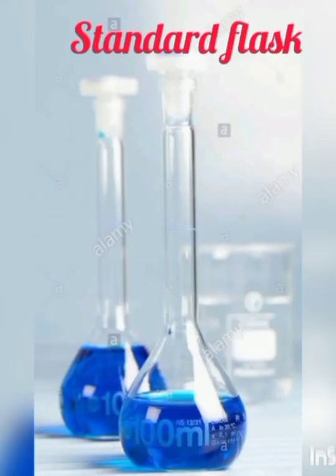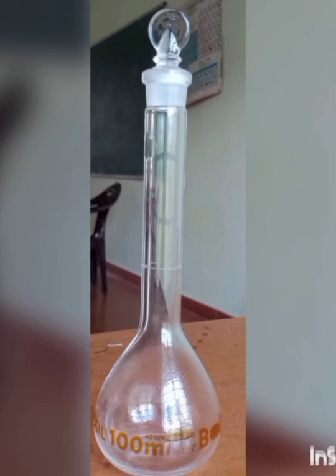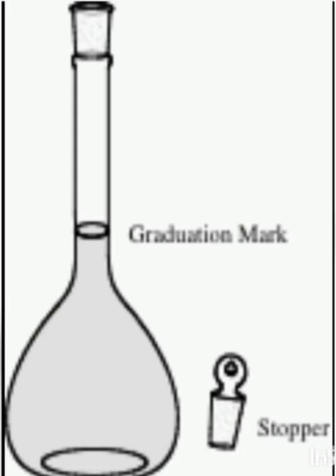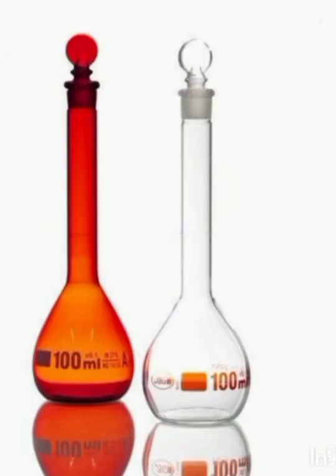Standard flask. A standard flask is also known as a measuring flask, volumetric flask or graduated flask. A standard flask is a type of laboratory flask calibrated to contain a precise volume at a certain temperature. It is a long, narrow-necked flask with a tight-fitting glass stopper. The neck of the volumetric flask is elongated and narrow, with an etched ring graduation mark. The marking indicates the volume of liquid contained when filled up to that point. Standard flasks come in various capacities such as 50 ml, 100 ml, 250 ml, etc. Volumetric flasks are used for precise dilution and preparation of standard solutions.